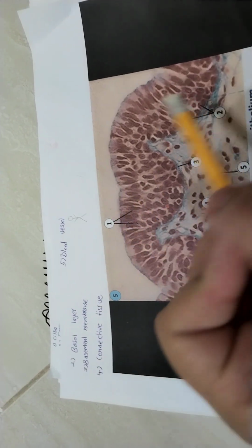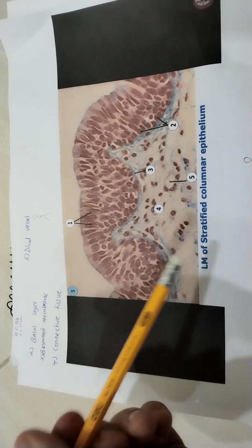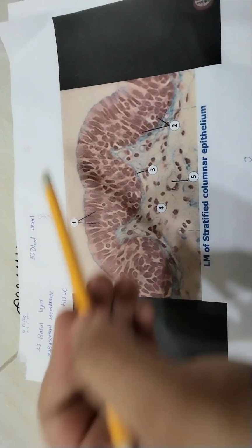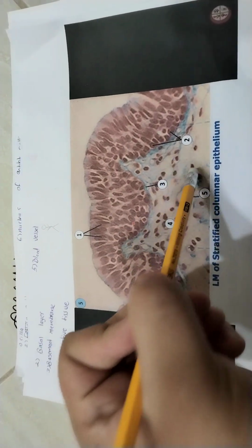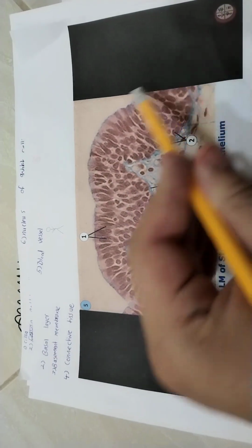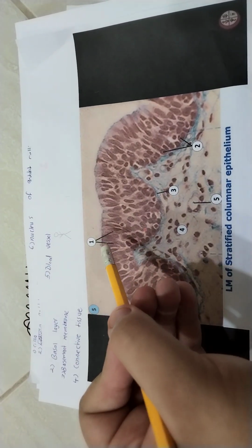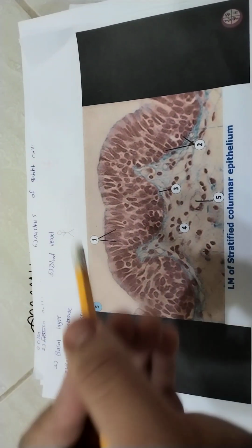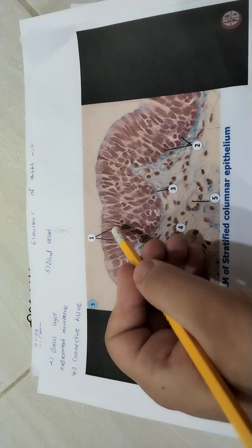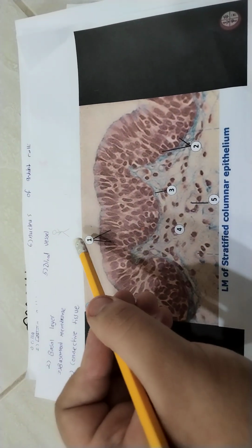Here I have a slide. In college, in the exams, mostly if you have a paper exam, the slides will come just like the one I showed you here, and each number has a name or it's a structure and you should write it, okay? First, you will write the slide name of the epithelial type. After that, you will write the structures, for example, the nucleus, the basement membrane or basal membrane, and the connective tissue. It depends on what the teacher tells you to write. You may get 1, 2, 3 or A, B, C. Okay, depends on the exam.